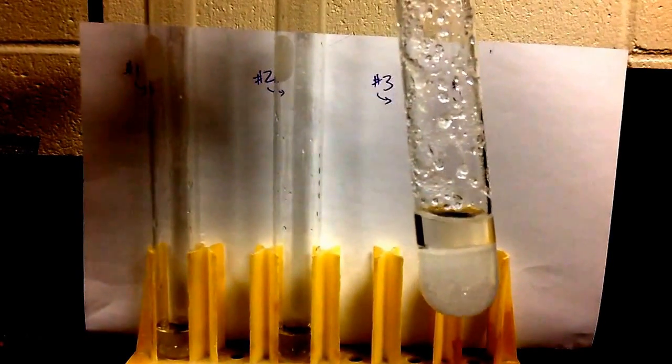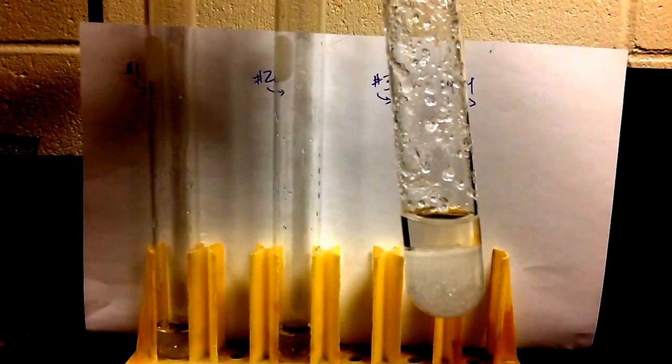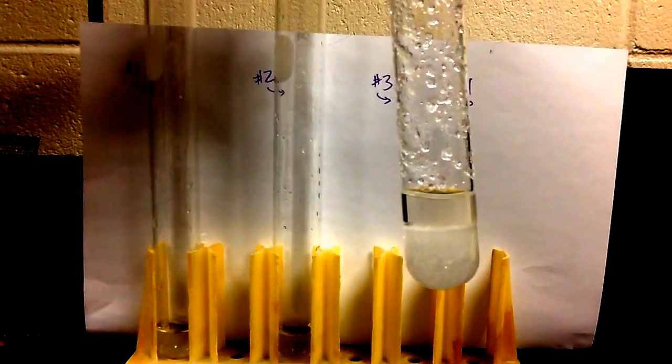add a crystal to it, and if that crystal does not dissolve, then that solution was saturated, and that's exactly what happened.